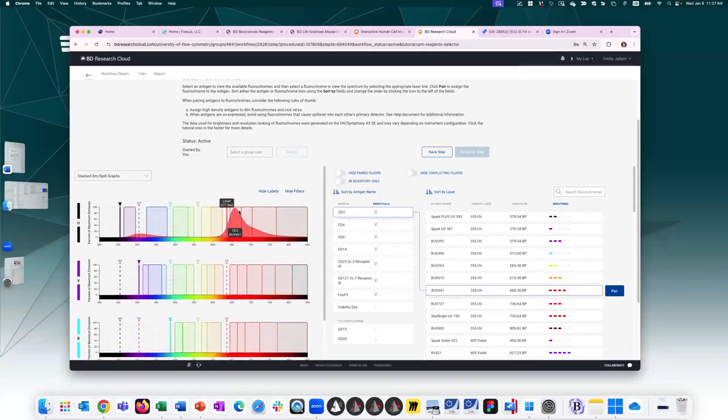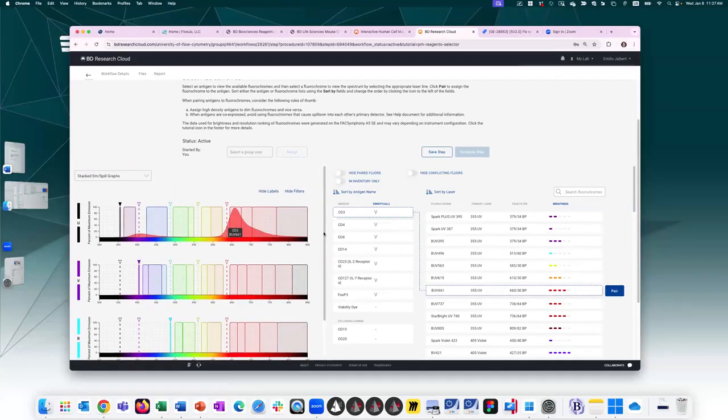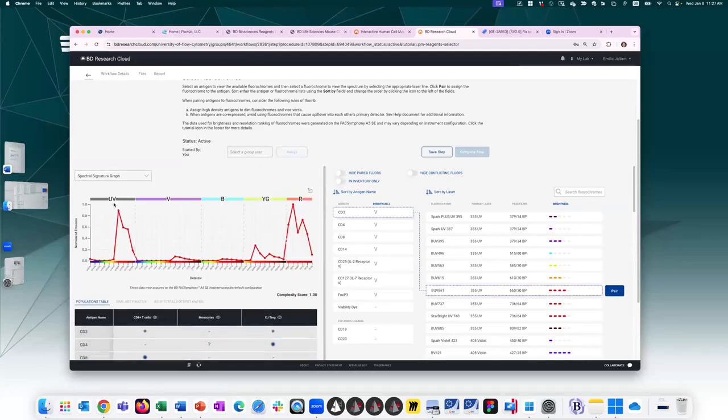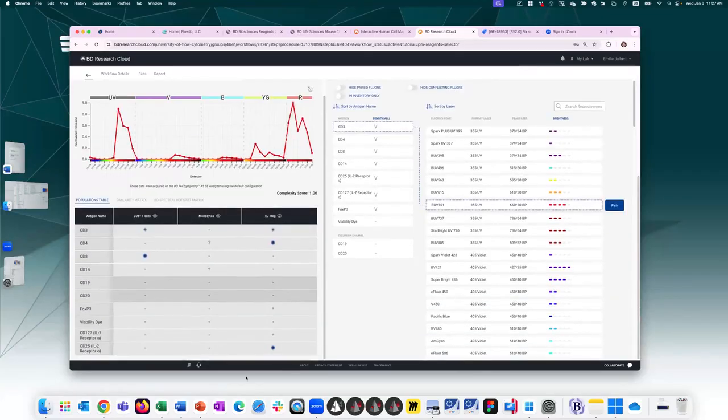So the filled curve shows the emission on the primary laser, and then the dashed curves show you the spillover, the cross laser spillover that the fluorochromes might have. So back to the spectral signature view. If I look below the spectrum viewer, you see the population table that you created on the previous step, and you'll also have these two other tabs, the similarity matrix and the hotspot matrix, that will become available once I've assigned fluorochromes to markers. So where to start?